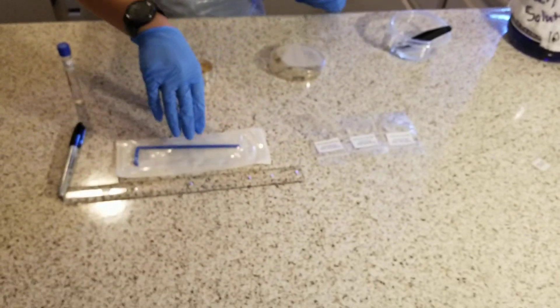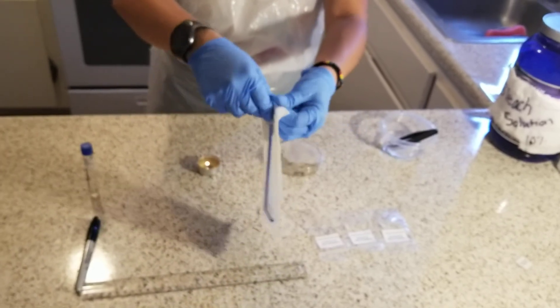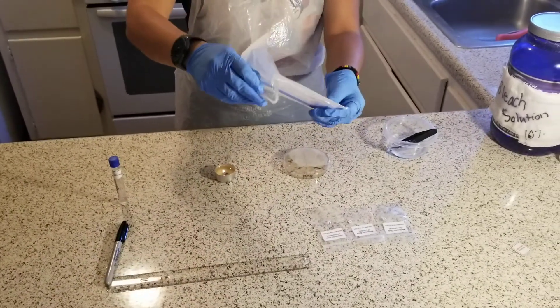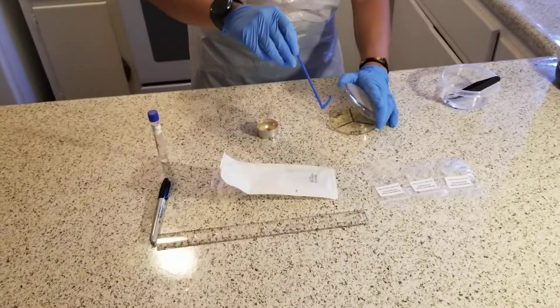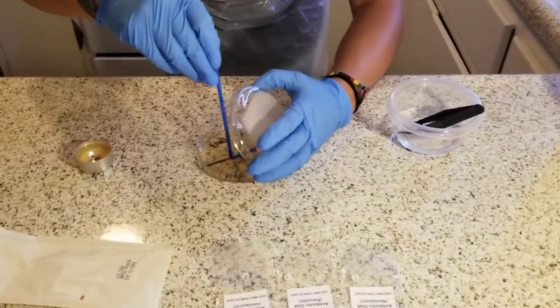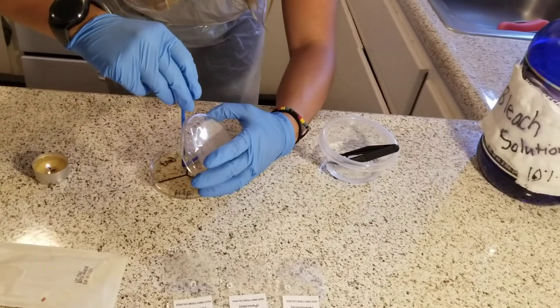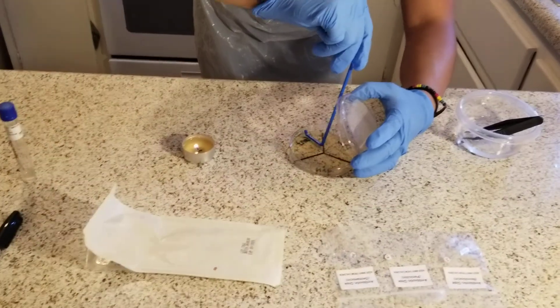In the lab kit, I've been provided with an L-shaped spreader. When I open it, I have to make sure to only touch the long, straight end. It's in sterilized packaging. I'm going to use it to spread the broth around the agar plate evenly, just so that the bacteria gets all around the agar plate.